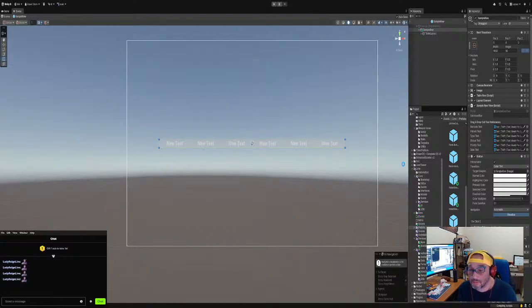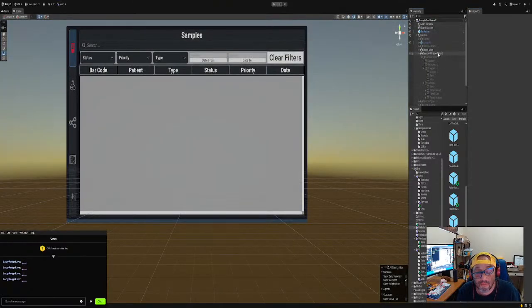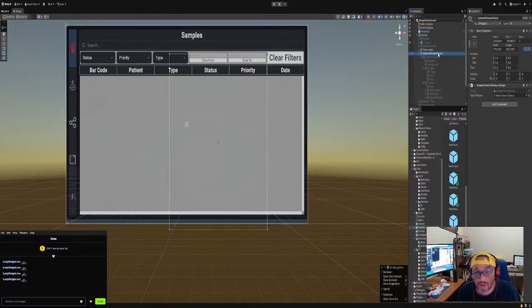Come on, let's go. Sorry, it's working. On here, what we're gonna do is pass that method, right? Display data. All right, we'll fix the index in a minute. I just want to make sure it's working. So right now we have the sample window that's the parent that's always open, right? With a child, we have to tell the child right here. And we just want to make sure that it opens when we want it to. And then we'll fix the other stuff later.